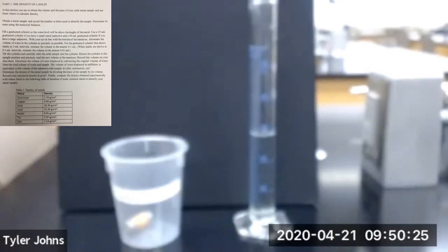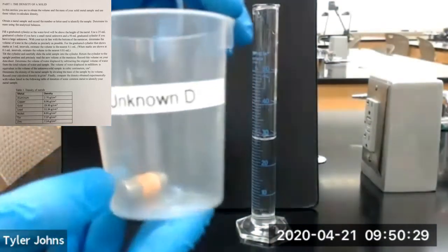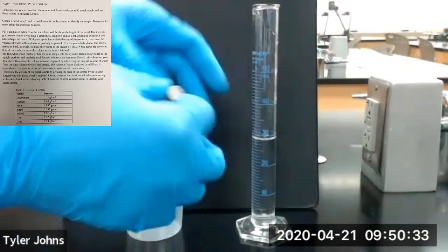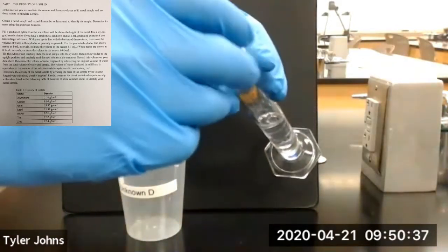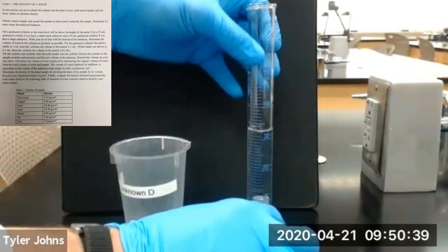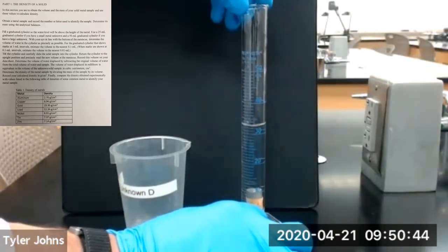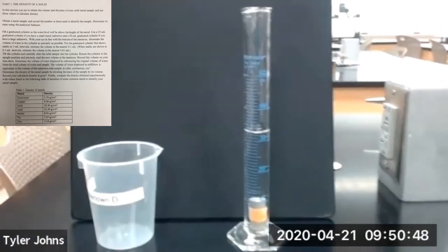Next we are going to add unknown metal cylinder D to our 50 ml graduated cylinder gently. And then we will determine the new volume of water.